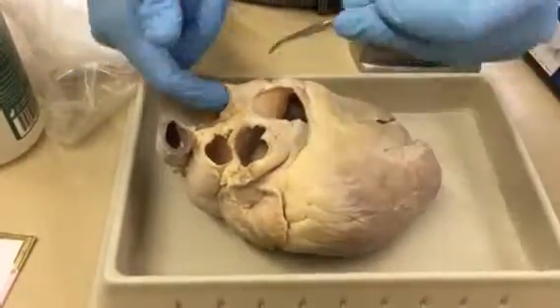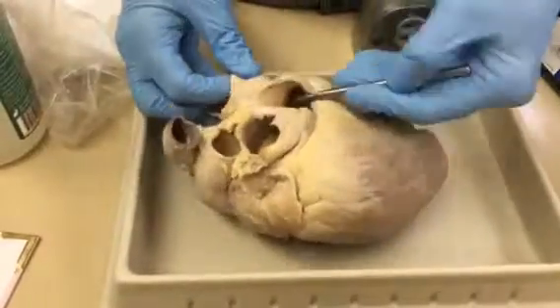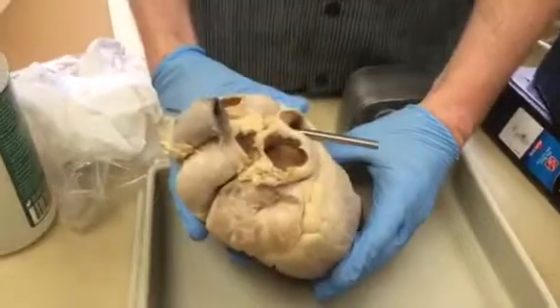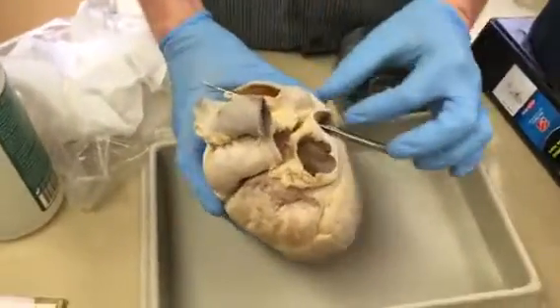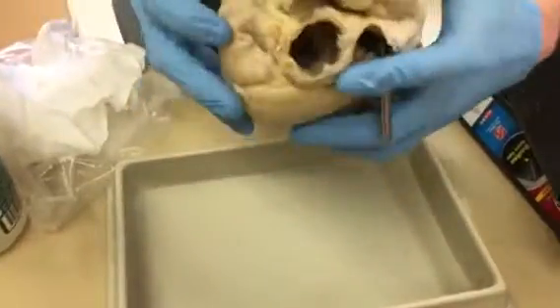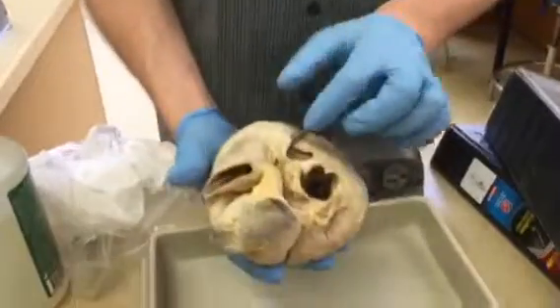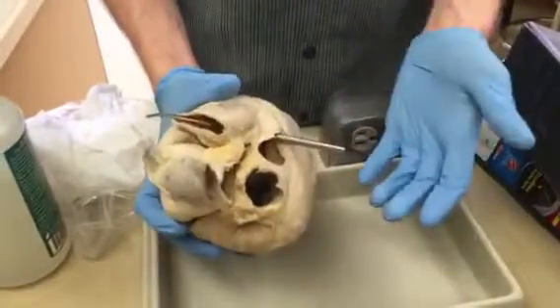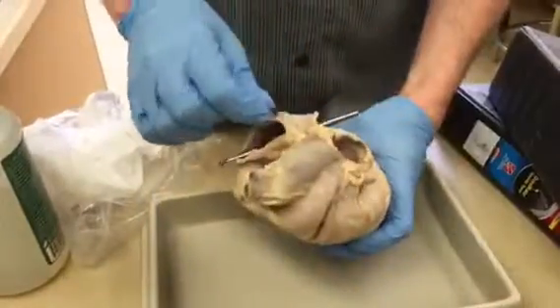Okay, and this is the inferior, and the way you can tell that is if they both go through like that, then you know they're going into the same chamber. Okay, now ours in human goes down a little bit more. It's not quite out like this because our heart is like that, not like that. So it comes out a little bit more than ours does, but there you can see that both of them, inferior and superior, right?